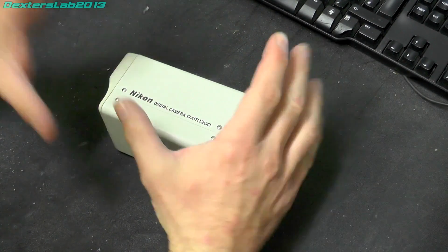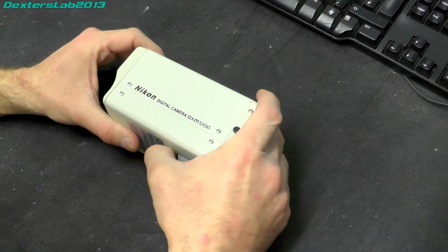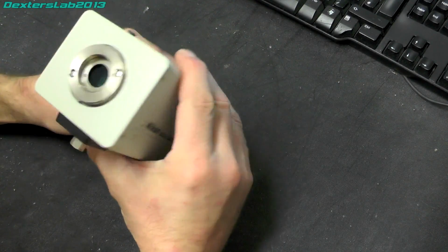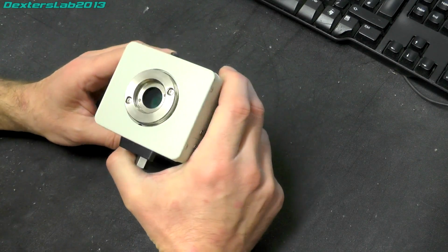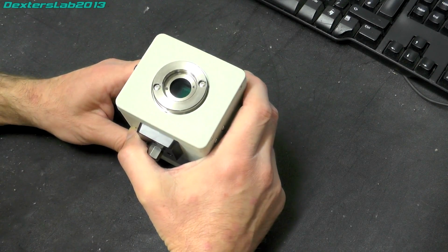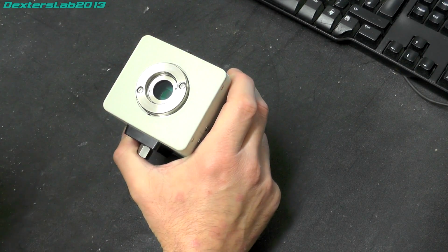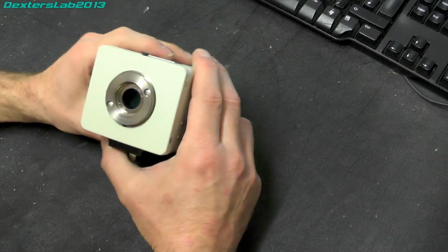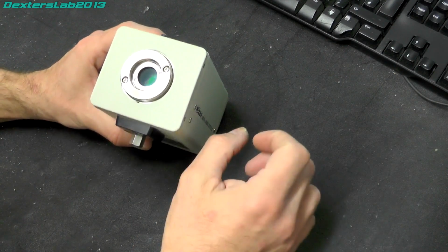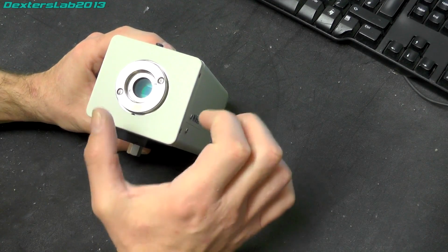So reading more of the marketing blurb for this camera, it seems what Nikon have actually done for this setup to achieve the high resolution, relatively low resolution CCD is actually to move the CCD while it's taking the actual image. So I think what they're doing is the CCD is mounted on a movable structure, which allows the CCD to move left, right, up and down.